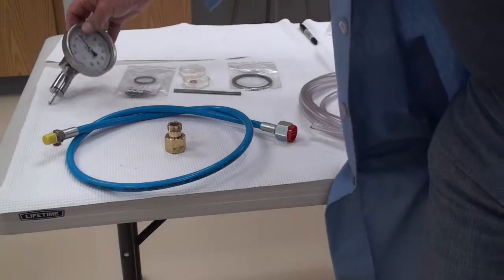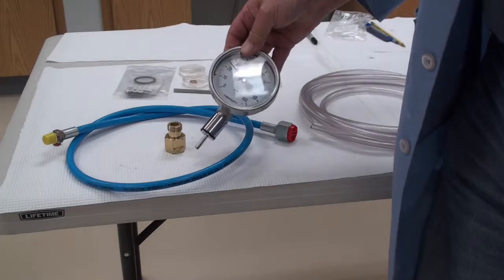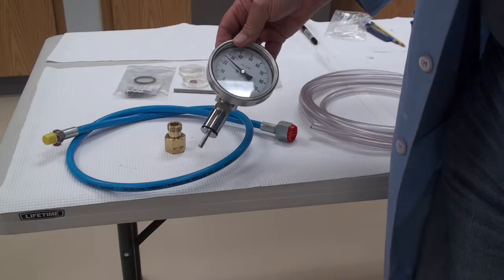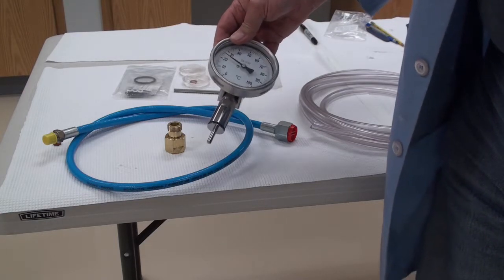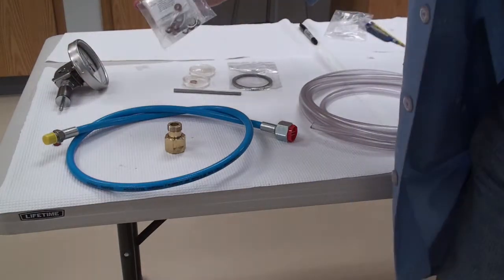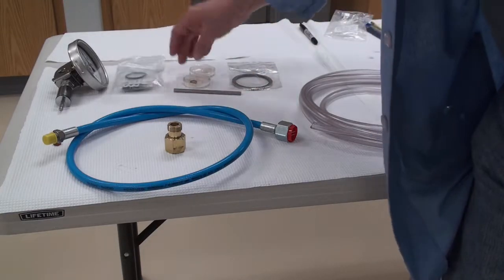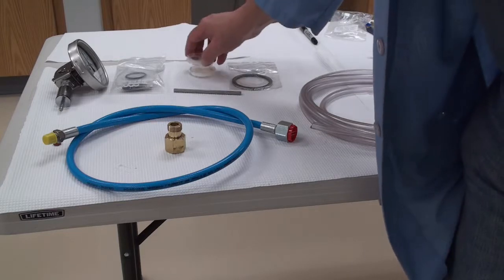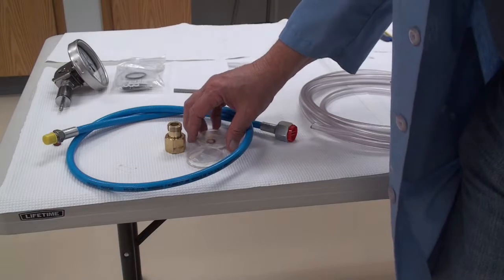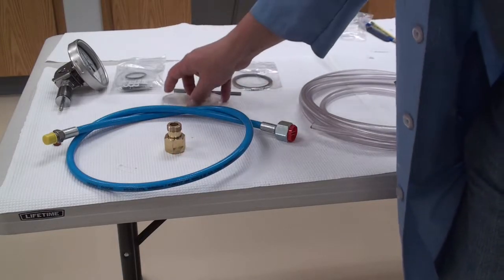You have the thermometer temperature gauge which will get inserted in the side of the critical point dryer. It's removed for shipping purposes. I'll show you how to do that shortly. It's quite simple. Some spare O-rings and valve seals that come with the system. A copper washer and a spare burst membrane in case you over pressurize the system and the safety device activates.